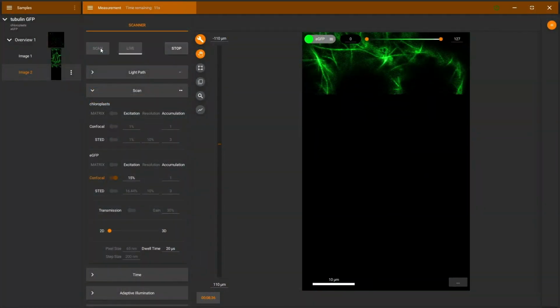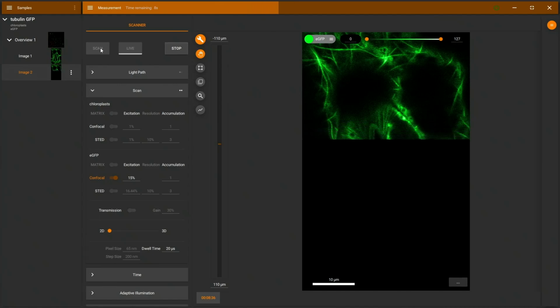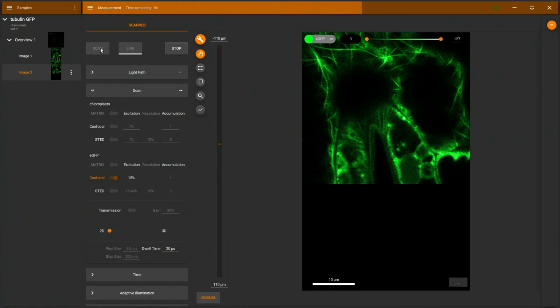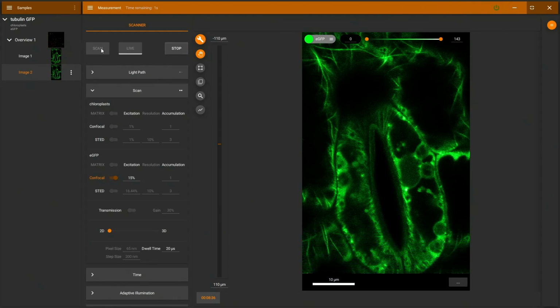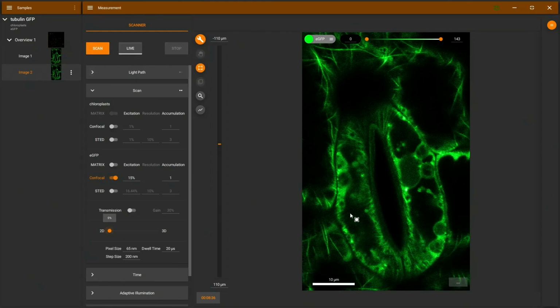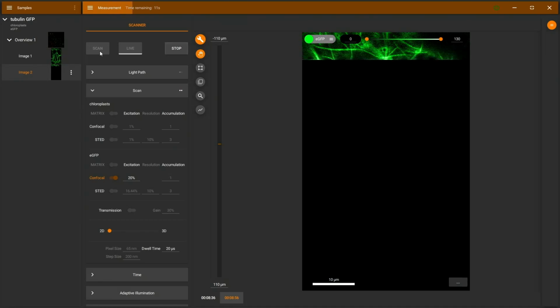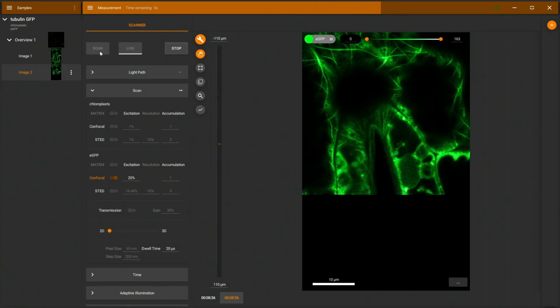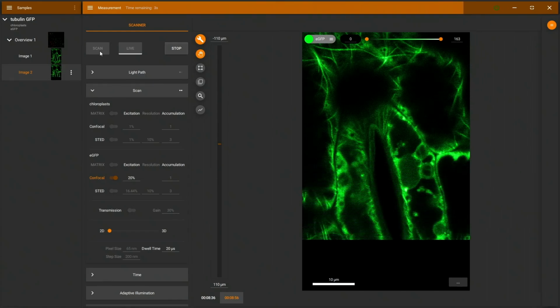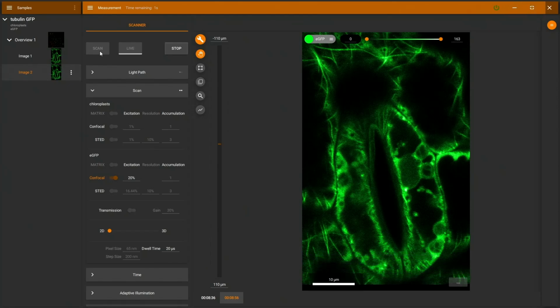And here we can see several bright microtubules, but also in the stoma quite a few densely packed structures. What we can see is that there's also a little bit of haze from out of focus structures in the densely packed areas. I'll crank up the excitation a little bit more, record this once more, just to get a little bit more signal. And again, quite a lot of densely packed structures here. What I would like to do now is record this again with matrix detection.